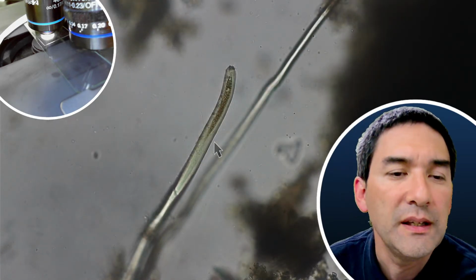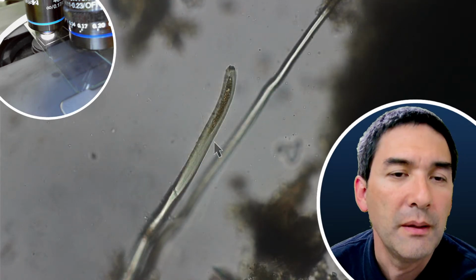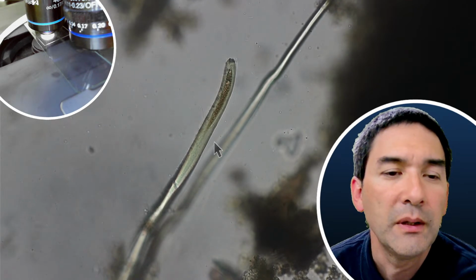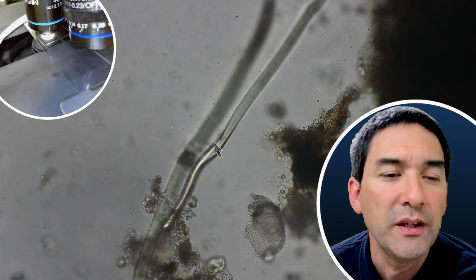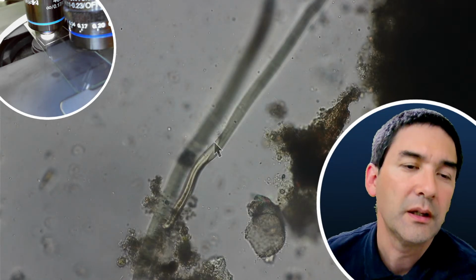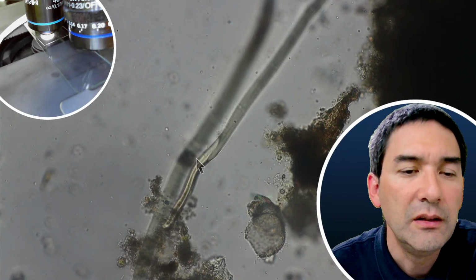One of the things is that it does not seem to be made of cells, because I'm not able to see the cross divisions here. And in one case, I've also seen that it actually started to become thinner and thinner and thinner. Here maybe a little bit. Look, like the one over here, which is an indicator that we're actually at the end.